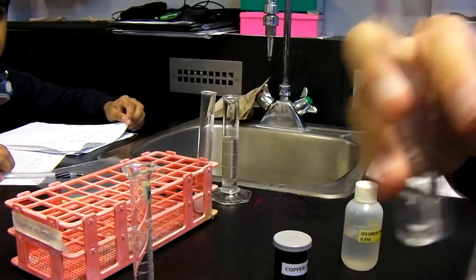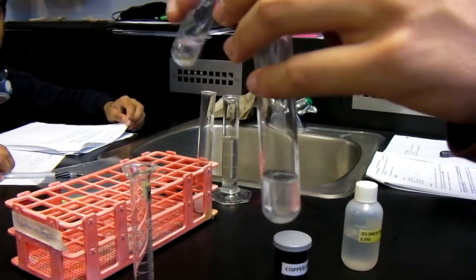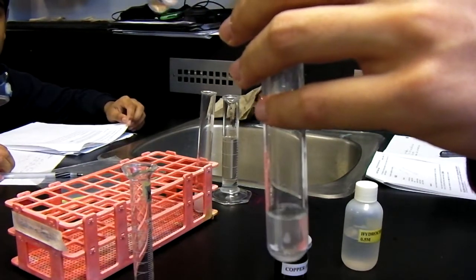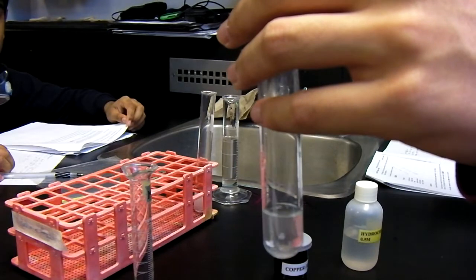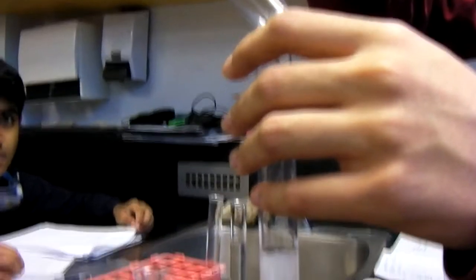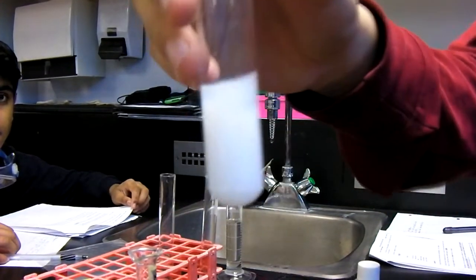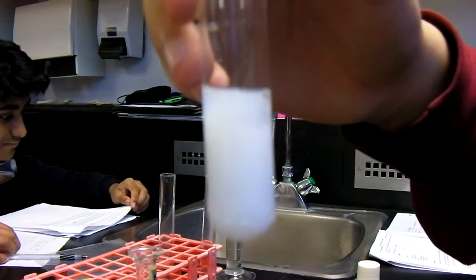We then poured the magnesium sulfate solution in test tube 1 into the sodium carbonate solution in test tube 2. We noticed a double displacement reaction had occurred, leaving us with a solution of magnesium carbonate and sodium sulfate. The solution was white and opaque. This is what it looks like.